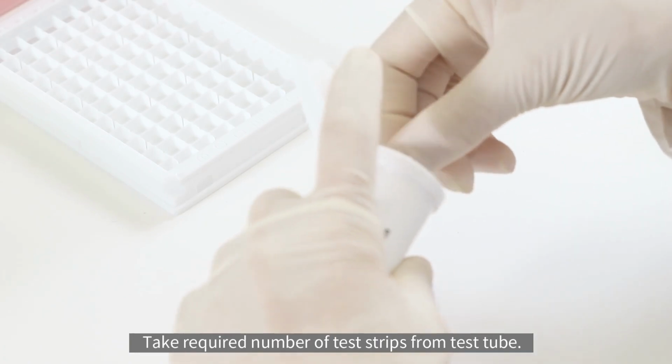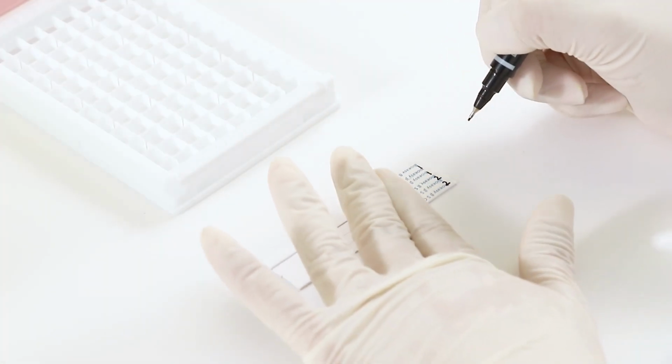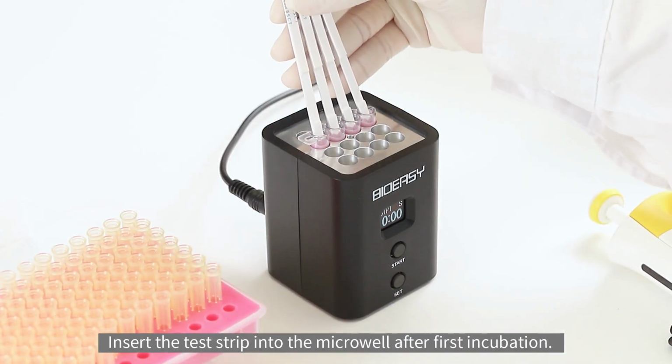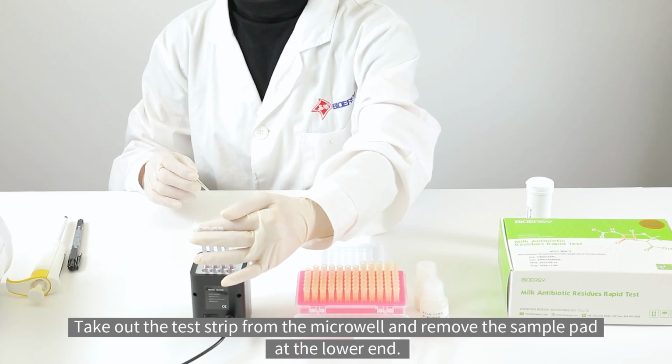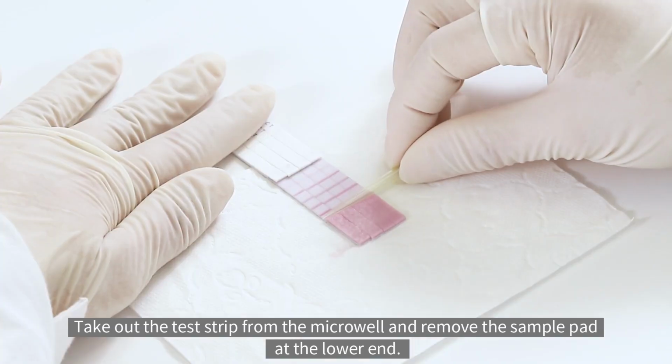Take the required number of test strips from the test tube. Insert the test strip into the microwell after the first incubation. Incubate another 7 minutes. After incubation, take out the test strip from the microwell and remove the sample pad at the lower end.